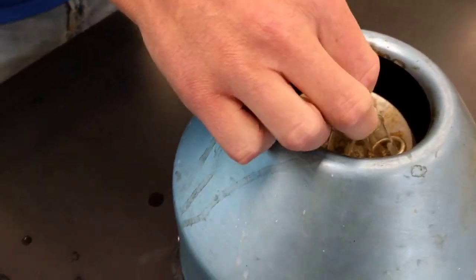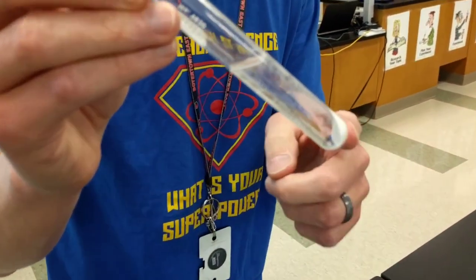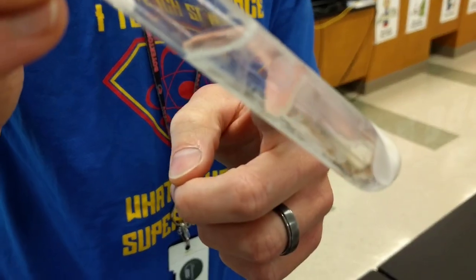In this case, the more dense object goes to the bottom. So we've separated the cornstarch from the water.